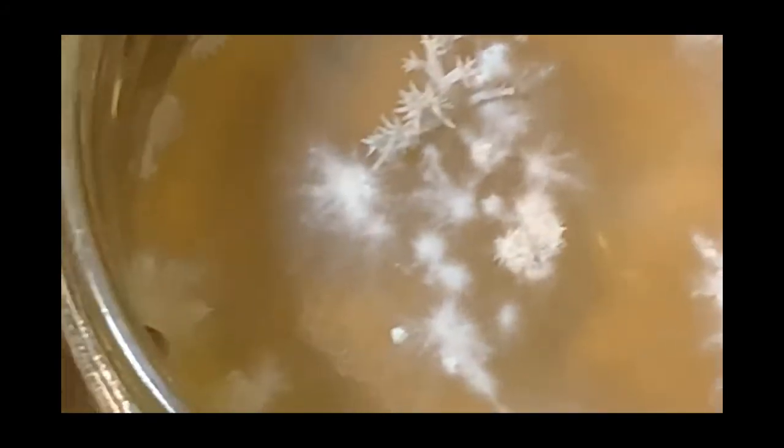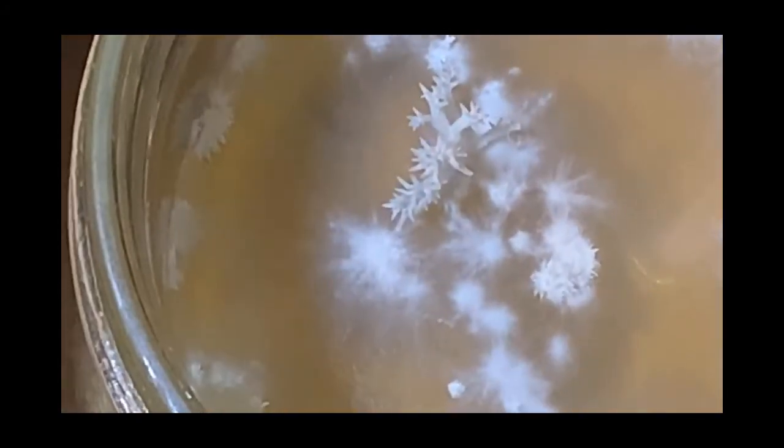That's lion's mane. This has had 16 days since inoculation.